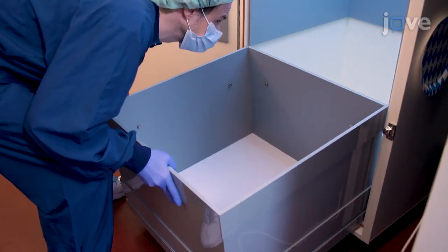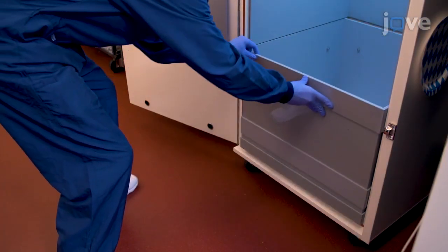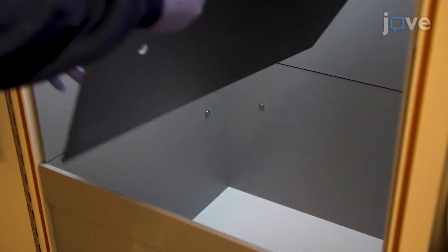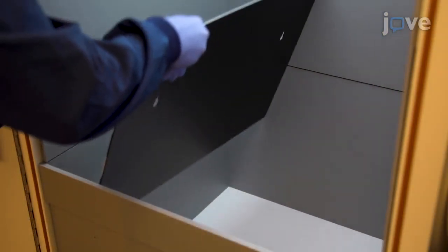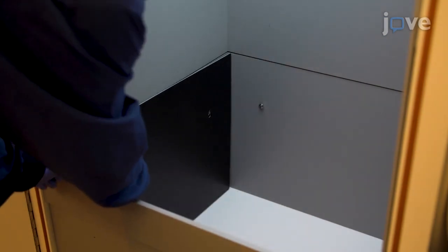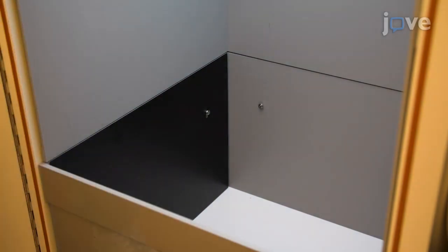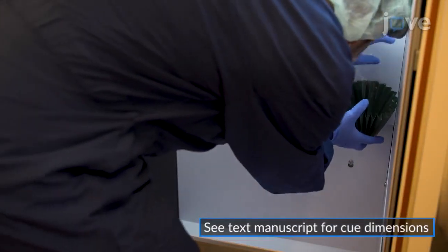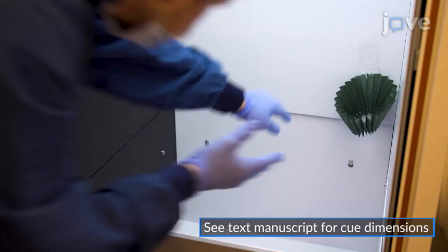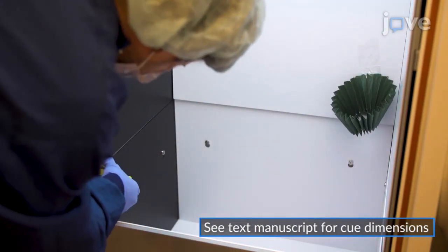Place the arena either inside a box or on a platform that is enclosed by a curtain. To create a context, insert a second layer of insertable walls in different colors or patterns into the arena. Hang 3D spatial cues that have distinct geometric shapes and colors high enough so that the rats cannot reach them.